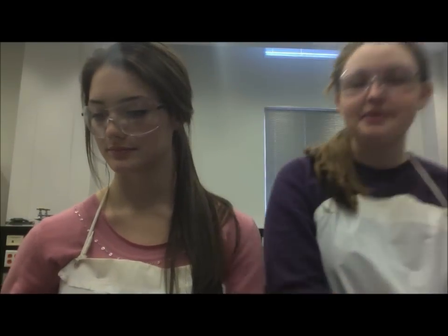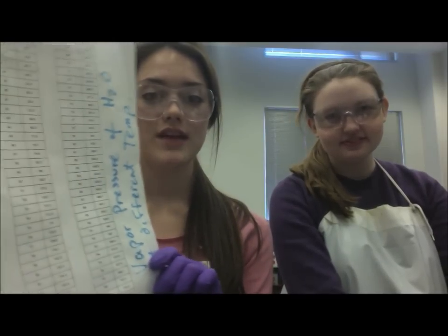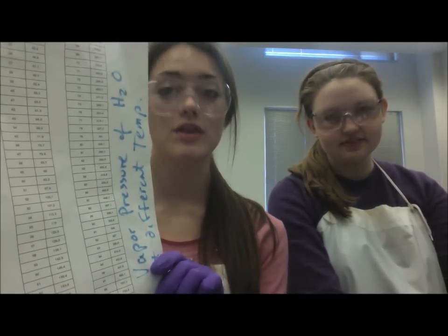Now that we have shown you how to properly do this experiment, there are a couple things we don't want you to forget. Number one, when doing your calculations, don't forget to subtract off the 10 milliliters of volume displaced by the hydrochloric acid. Number two, don't forget to record the barometric pressure for that day given by your TA. Number three, don't forget to record the vapor pressure associated with the temperature of your water bath from the lab room. If you use an outside source, it could increase your error.